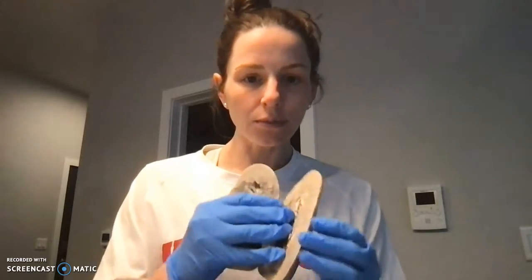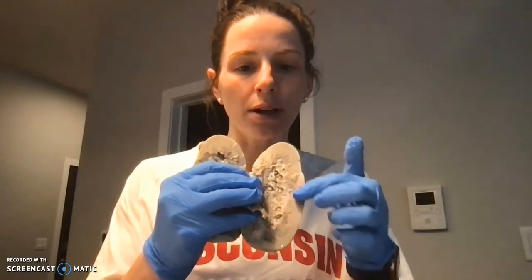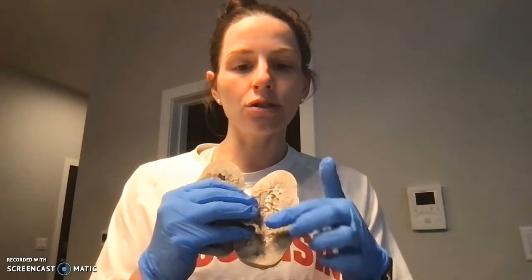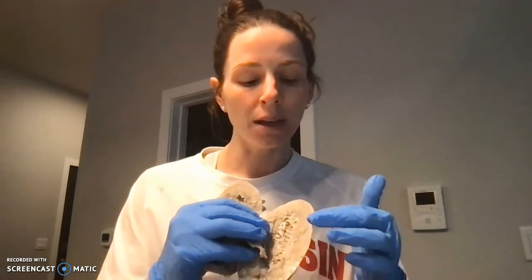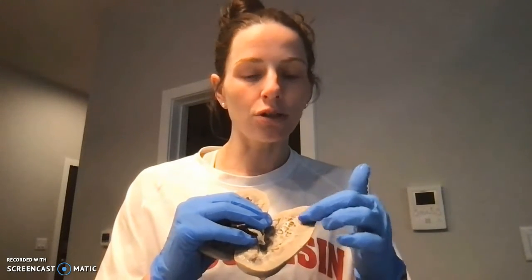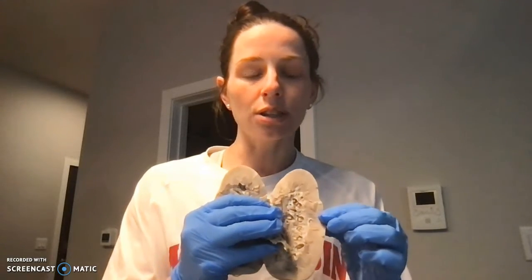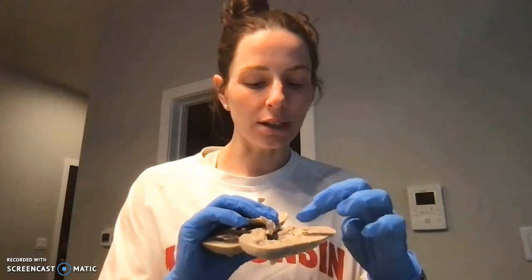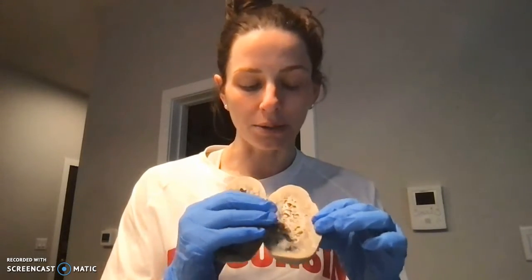And if we open up our kidney here, we can see this outer part of the kidney is called the renal cortex, and then the inner structure of the kidney where the renal pyramids are located is the renal medulla. So we have these pyramid structures on the insides of the kidneys, and those are separated by renal columns. So you'll see pyramid-like striations and structure in the kidney here.